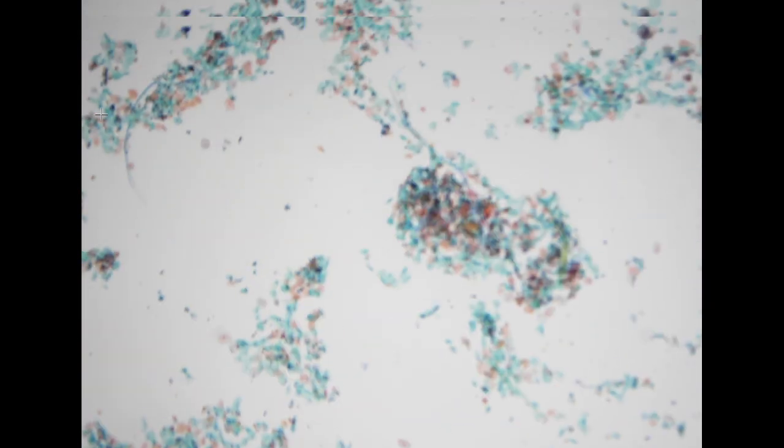So the next specimen is coming from a 61-year-old female, also a voided urine. She presented with intermittent hematuria for 2 to 3 months. On low power, we see a lot of squamous cells, particularly superficial cells, which means the specimen is likely contaminated with gynecologic tract elements.